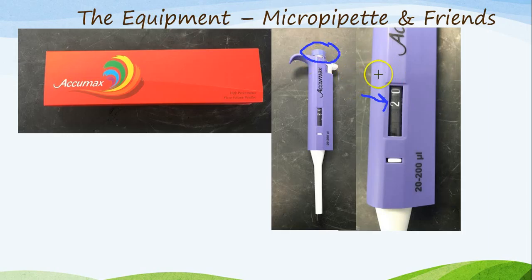These are a two-step micropipette, meaning when you push it down, you will feel that it will come to a stop at one step. When you push that down to that first step, it will draw up this amount of substance. After you're done drawing that up, you release the plunger in the upward direction. You will notice that in the bottom here, you will find there will be the exact amount that you want to draw up. The second step on this plunger happens to be used to expel all of a substance. So by pressing this plunger down to the first, then second step, you will expel all of the solution plus some more that is in there.